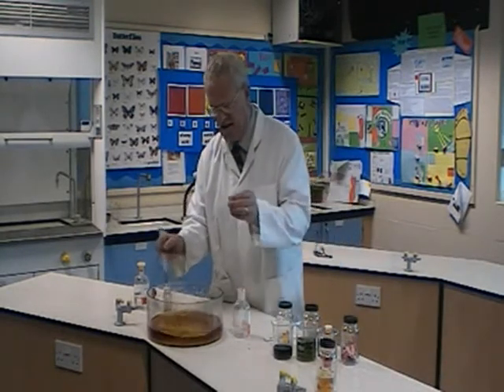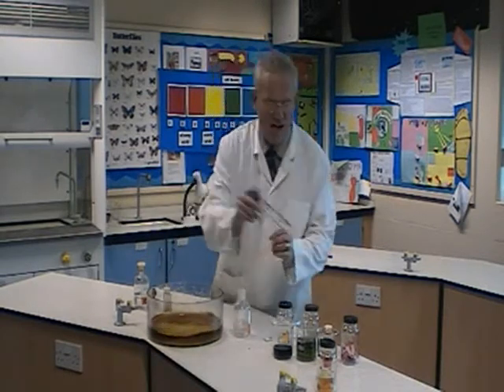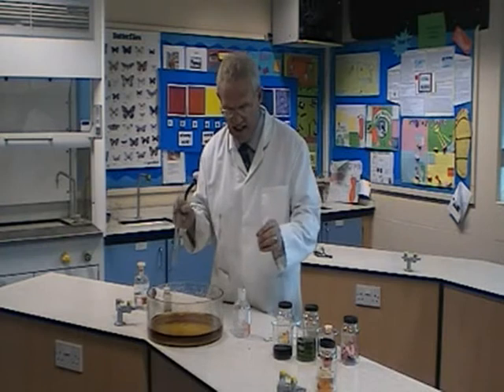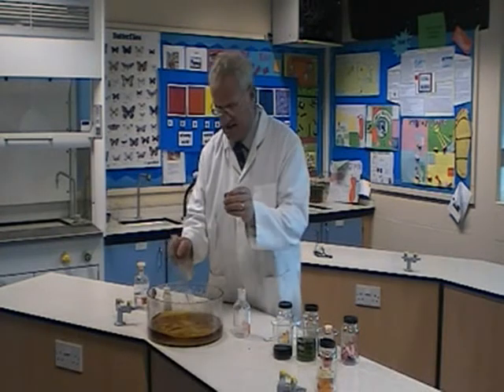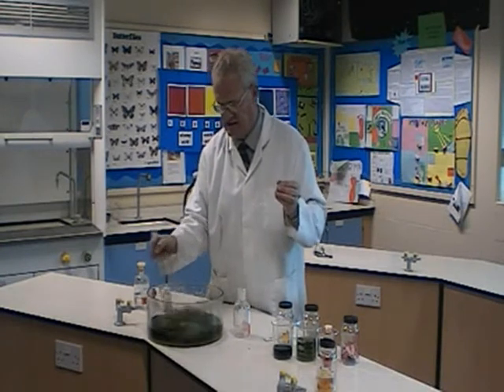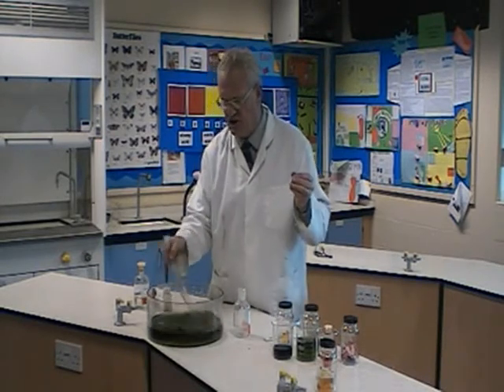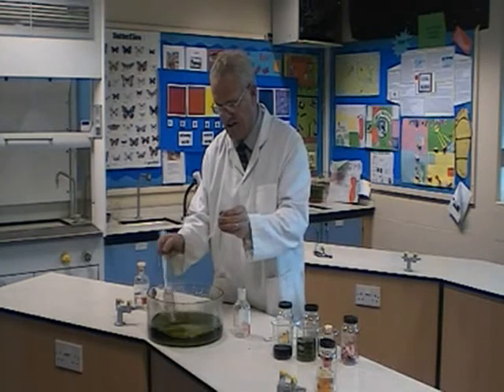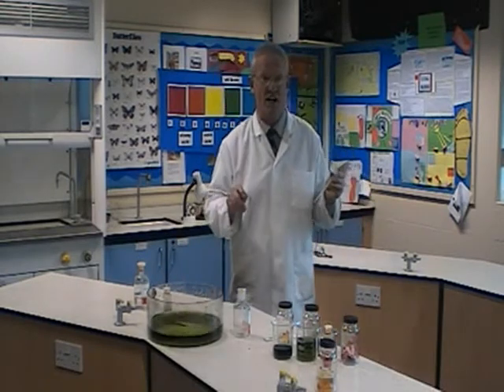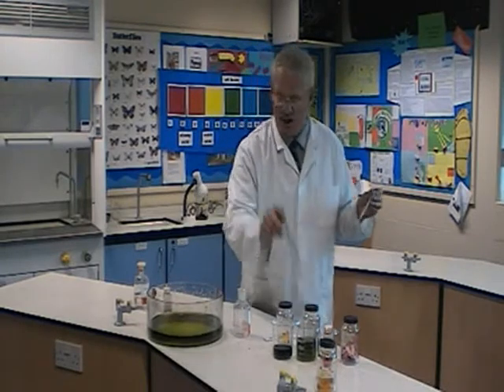Let's get a purer yellow than that. Once I have got an equal amount of acid and alkali in there, it should be a pH of 7, which is green. I'll put some more in — there is my green. You can go through shades of green, but I want a healthy green, like halfway between a light and a dark green. That's it — now that means it's neutralized. All my acid and all my alkali have cancelled each other out. I have neutralized them, and I have got green.